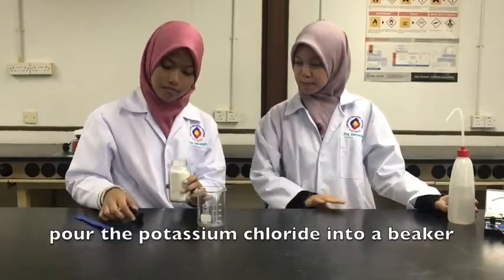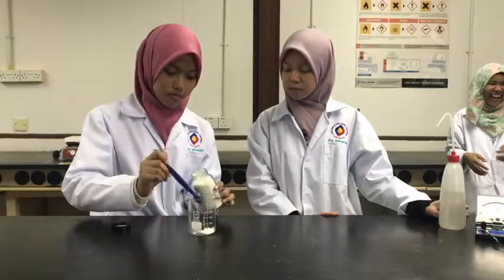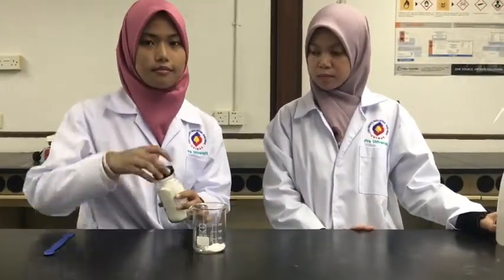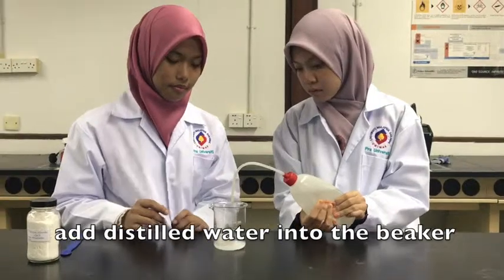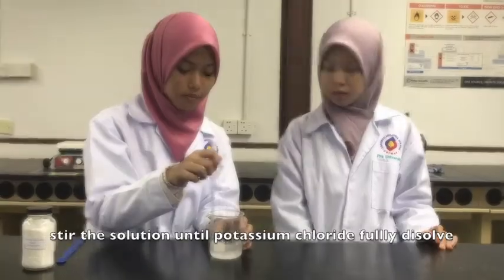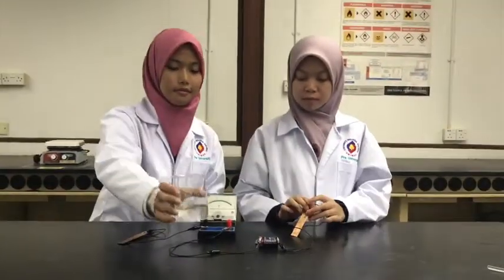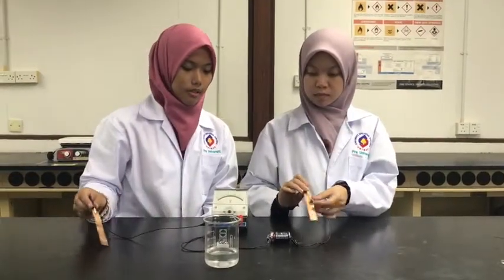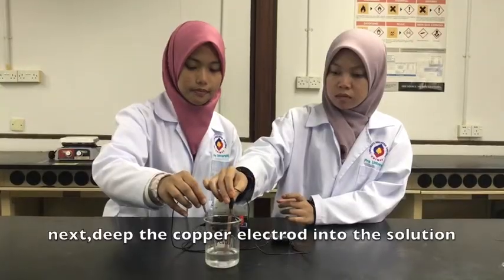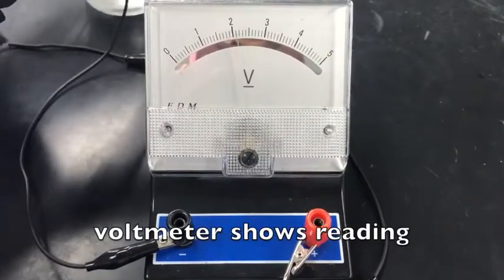Pour the potassium chloride into a beaker. Then, add distilled water into the beaker. Stir the solution until the potassium chloride is fully dissolved. Next, dip the copper electrode into the solution. The voltmeter shows a reading.